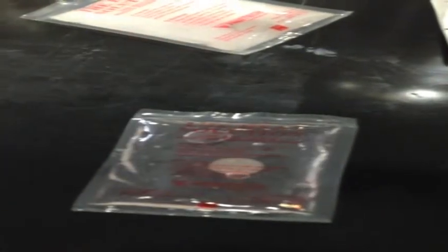What we're going to do today is watch this exothermic reaction. We have sodium acetate and water, and we can see there's a little metal disc in there. What's going to happen is we're going to take that metal and agitate the solution — so Mike, if you will crack that a little.